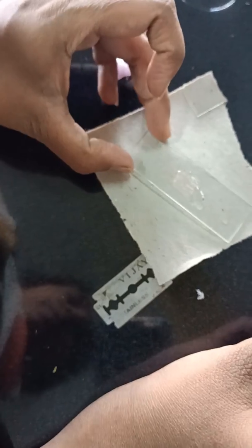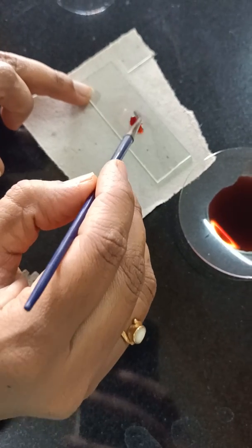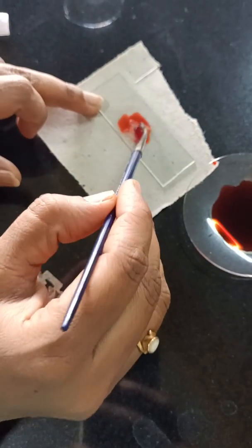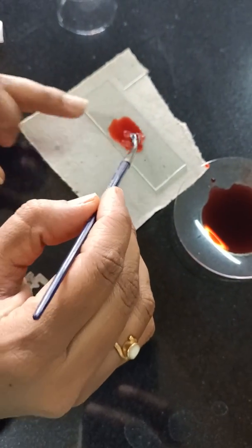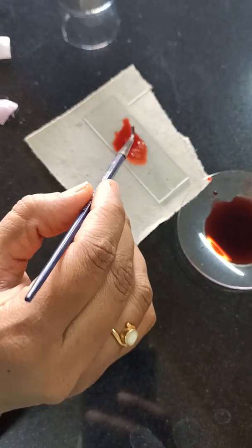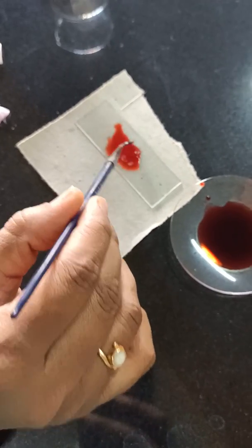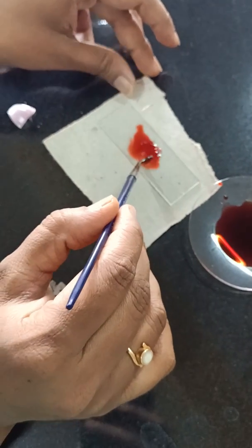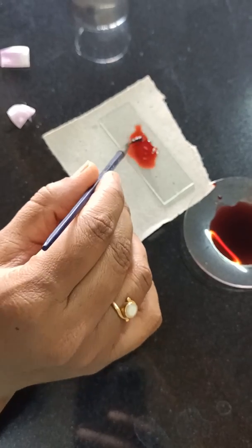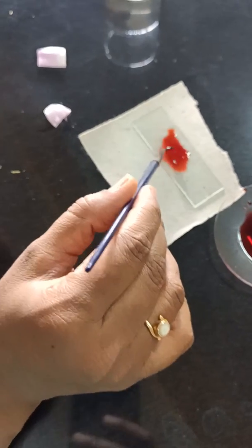After spreading, put the acetocarmine stain on it — which is an acidic stain specially used for staining the nucleus. Leave it for 5 minutes. Later you can put the coverslip and observe it under the microscope. Mount the slide using the coverslip in the same way as done for pollen germination. Allow it for a few minutes so that the peel can absorb the stain. Then I will show you how it looks under the microscope.